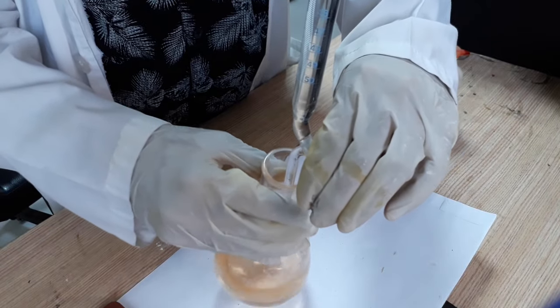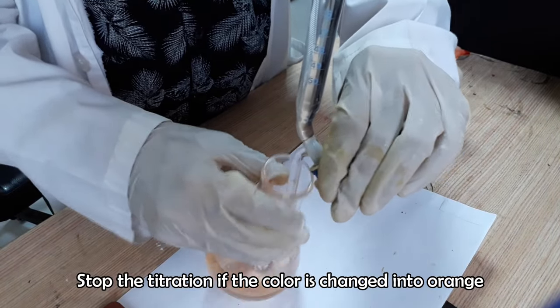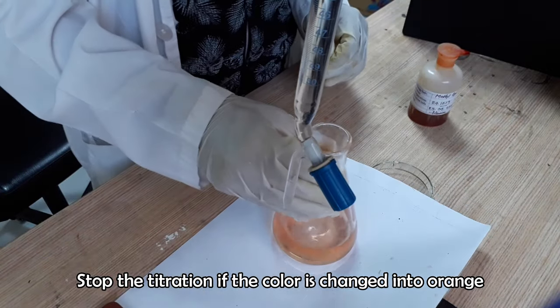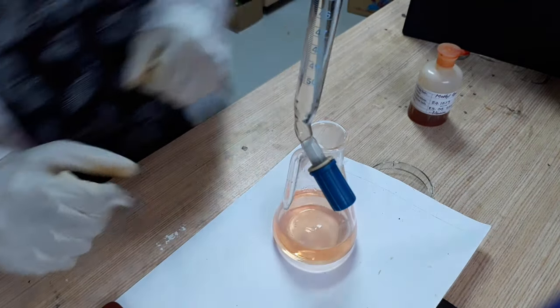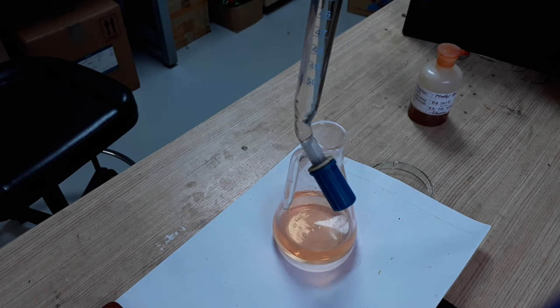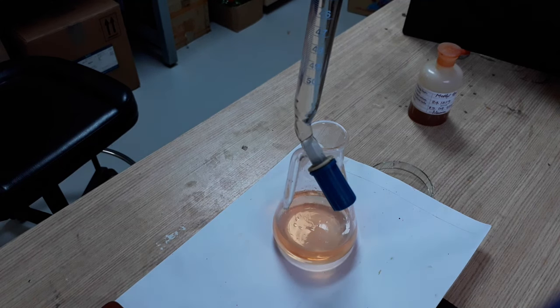Stop the titration when color is changed into orange. Note the final burette reading.